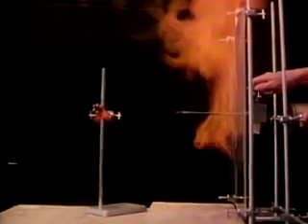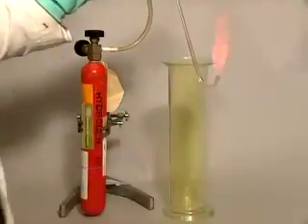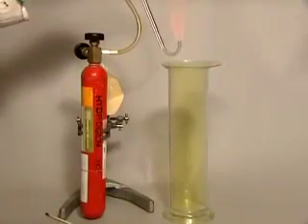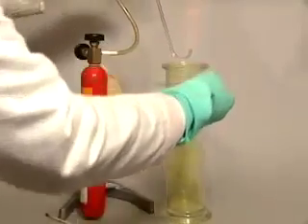Now the reaction between hydrogen and chlorine. I light the hydrogen at the jet and lower it into a jar of chlorine. The hydrogen carries on burning, but with a pale blue flame. When the halogens react with hydrogen, the hydrogen halides are produced: HF, HCl, HBr and HI. In each compound the halogen has a valency of one.